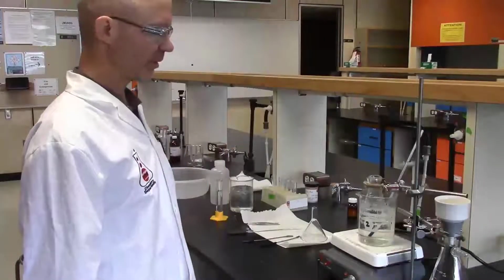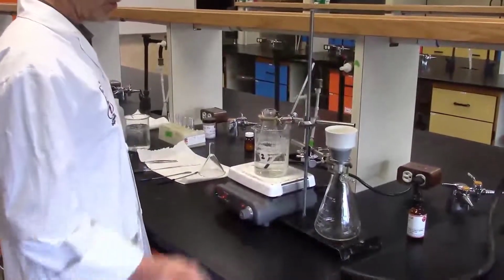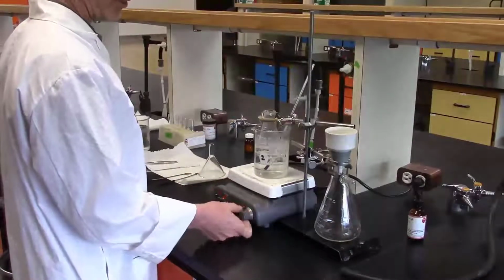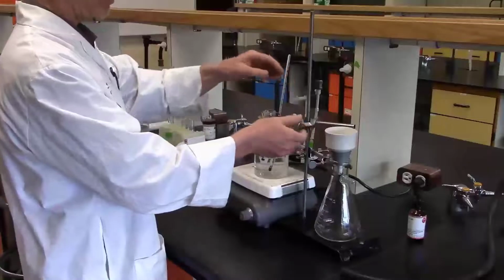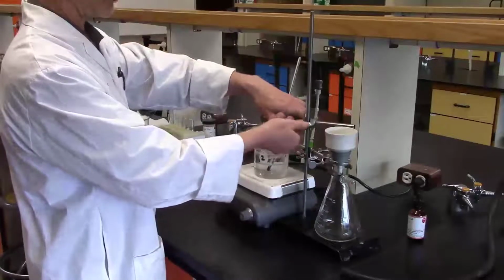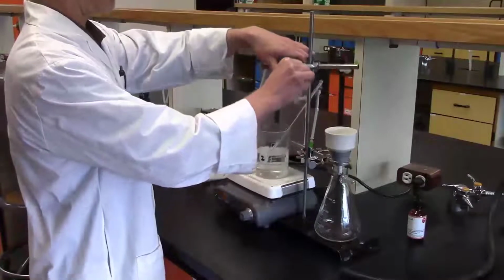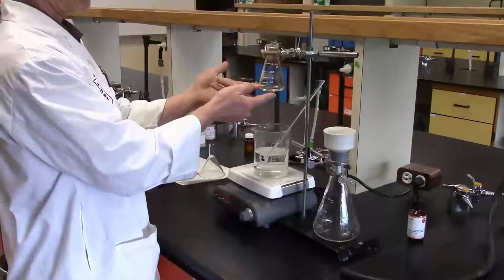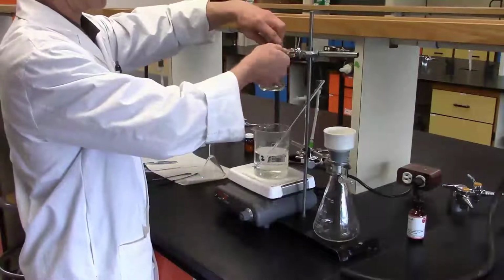This reaction has been going now for 15 minutes, and so we're ready to terminate the reaction. One of the things that I really strongly encourage you to do is now turn off the hot plate so that you don't risk burning yourself later on. The easiest thing to separate the Erlenmeyer from the boiling water bath is just to lift the clamp on the retort stand. The bottom part of the Erlenmeyer is definitely hot, but the top part isn't, so I can hold on to that quite easily.